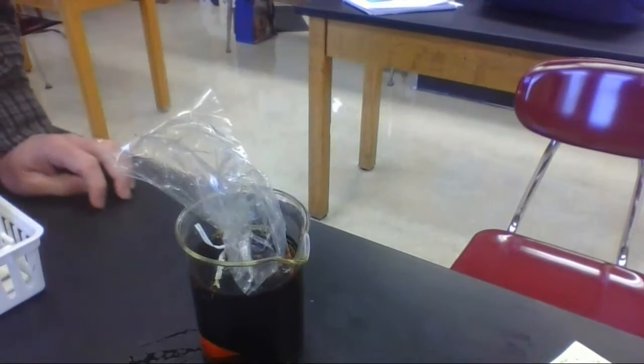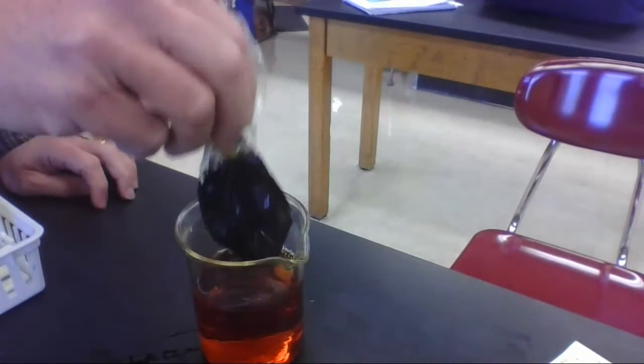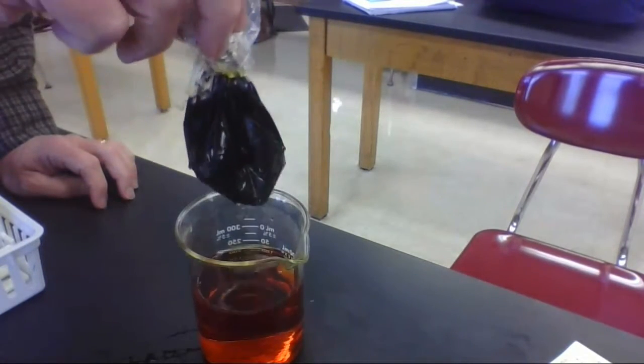Okay, here we are after 24 hours. We'll take a look at our model. And if we pick it up, we'll see a pretty big change here.